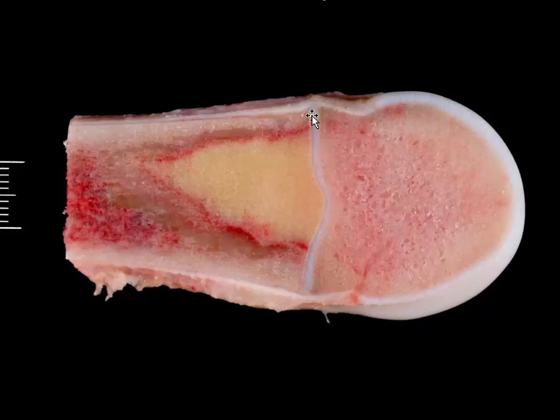We're looking at the growth plate of a foal, then the metaphysis. And there is a large area of infarction, and then surrounding that is hemorrhage. We always have hemorrhage at the edge of an infarct because there's no blood supply here. So you have hemorrhage. This is where the blood vessels end up, and everything trying to clean this up, the neutrophils, all the hemorrhage, is always outlining it.